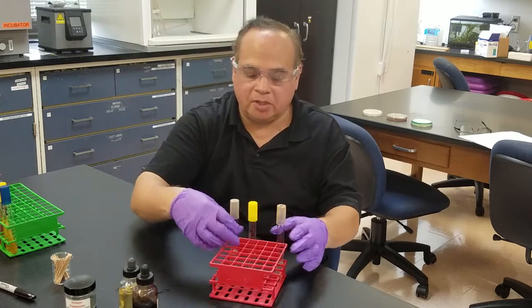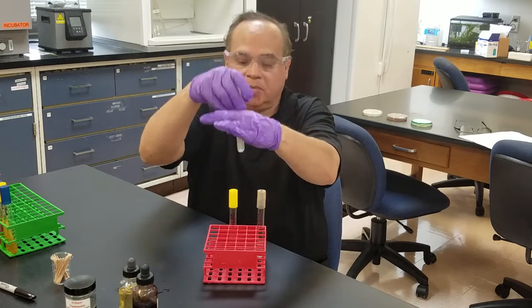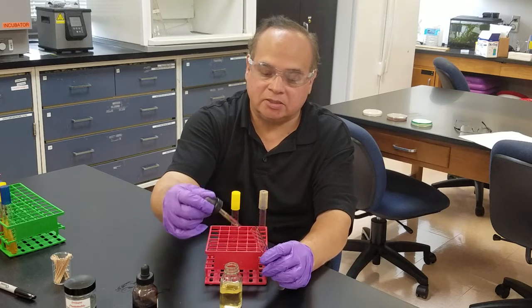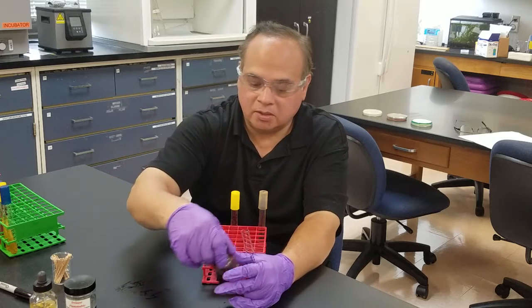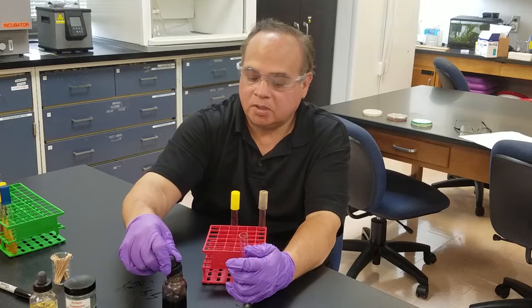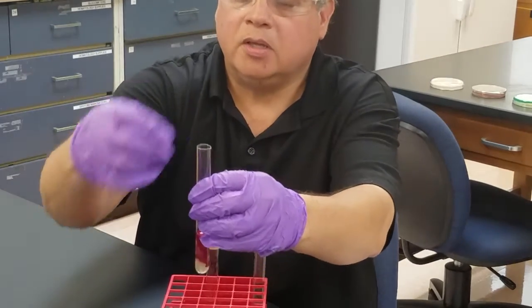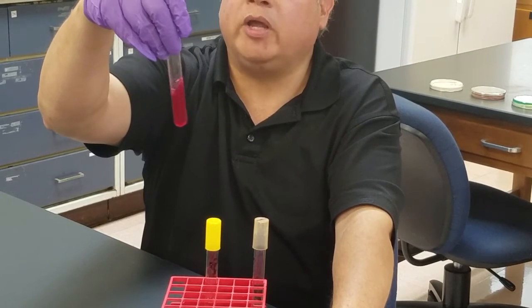The first step is something that E. coli does, so this tube is E. coli. I'm going to mix it up a little bit, then add about five drops of sulfanilic acid, followed by a few drops of alpha-naphthylamine, and there should be an immediate red color developed. You can see that red color — this is positive for the reduction of nitrate to nitrite.